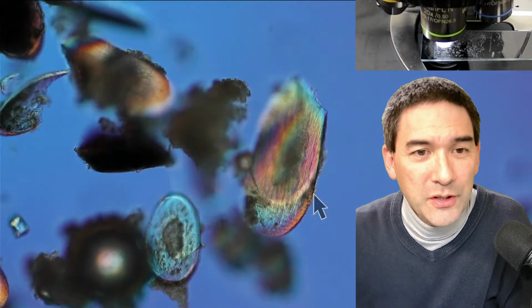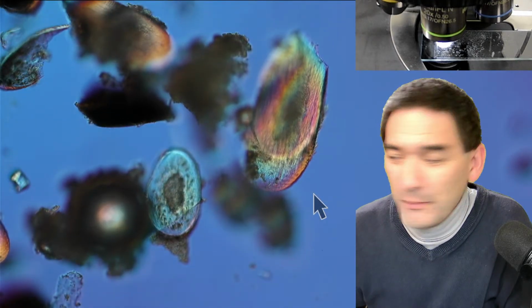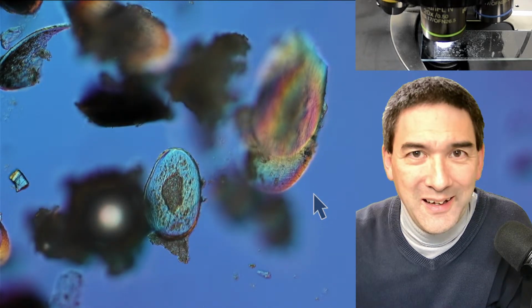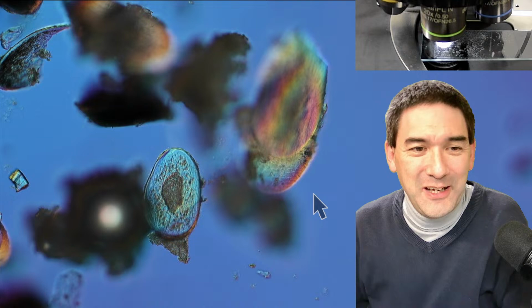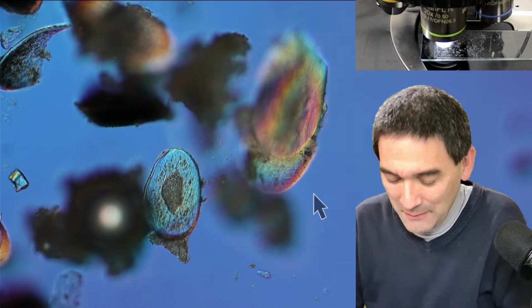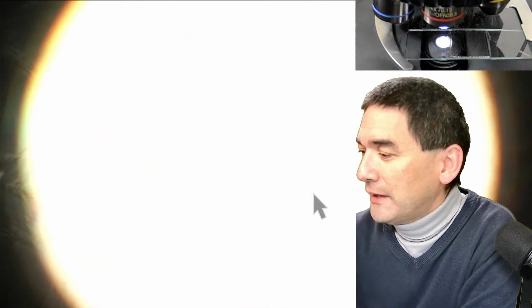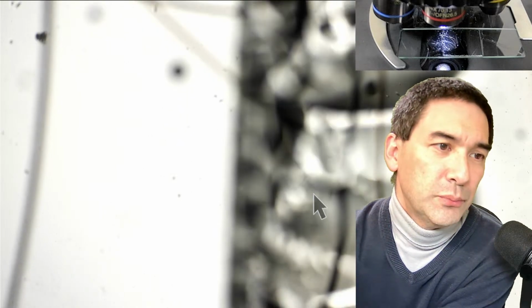Over here as well, and you can also see over here in the beard that obviously some of them are darker than others because, of course, with age, hair starts to turn white. But let's put this slide now under the microscope. So I'm going to go down with the magnification. You always want to do that first, and let's have a look now at the hair of my students. I'm just going to put it directly in bright field again.